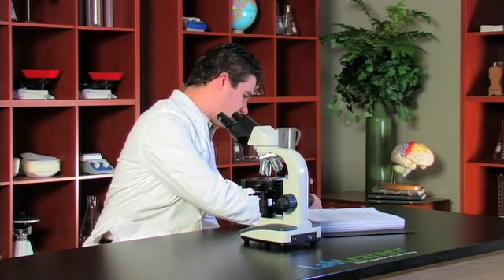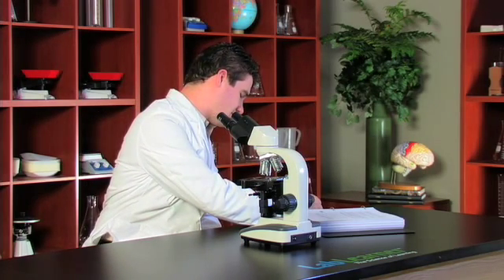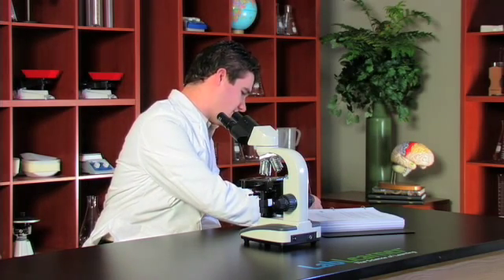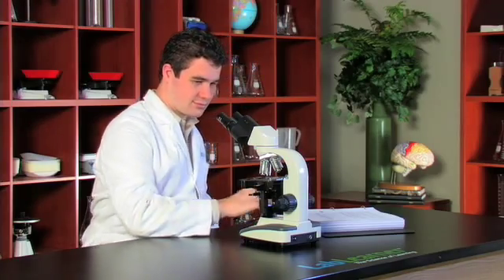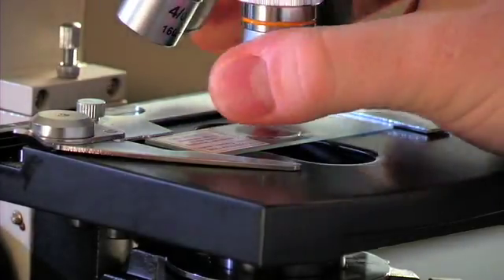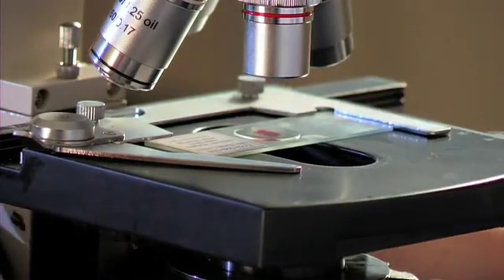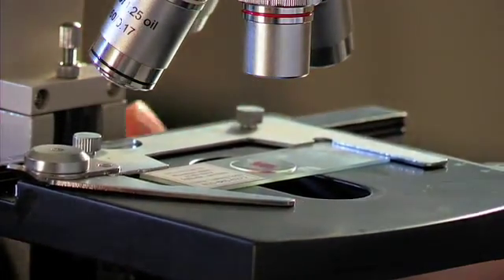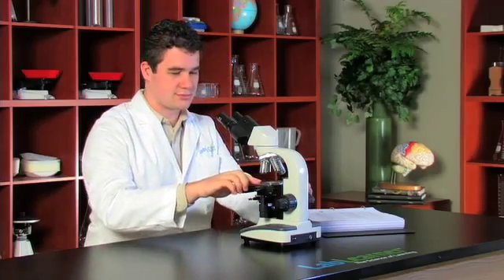After we look at the slides, students will then draw and label what they've seen in their SDRs. After viewing a slide, we switch back to the lowest objective lens and lower the stage completely before we remove the slide.